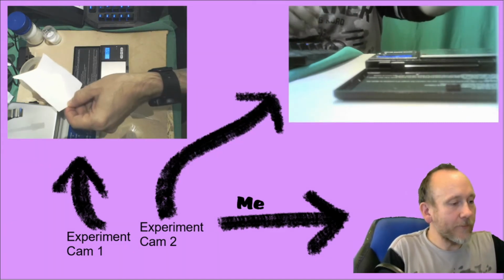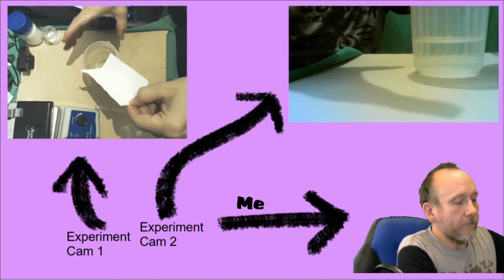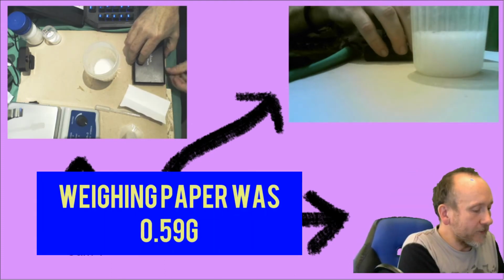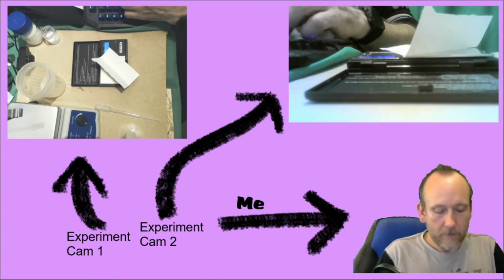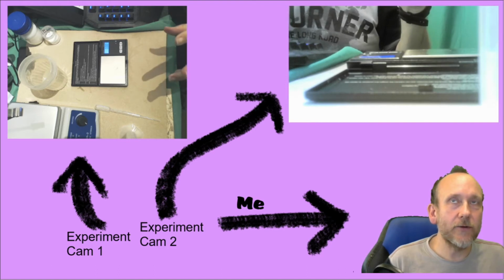It's measured approximately accurately. Now, okay, there we go. Now, what I should really do is measure the paper again, and the paper is now 0.61. So now, as the reaction went on, CO2 was evolved, and that means it came out of the solution.